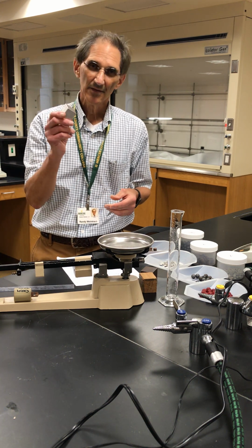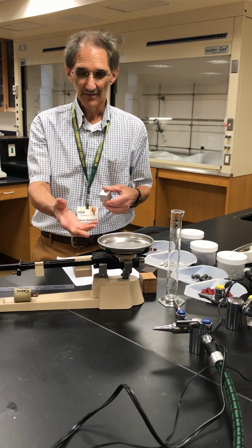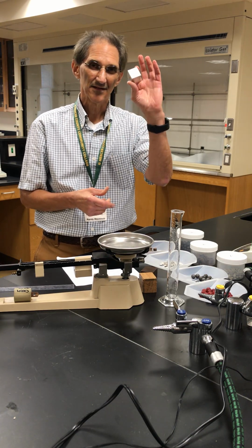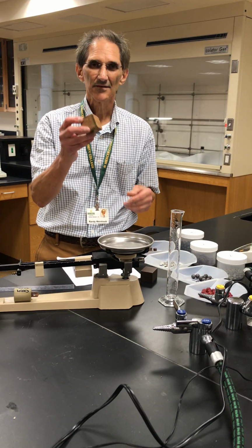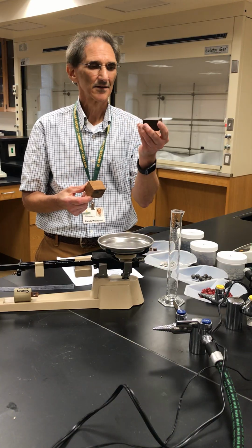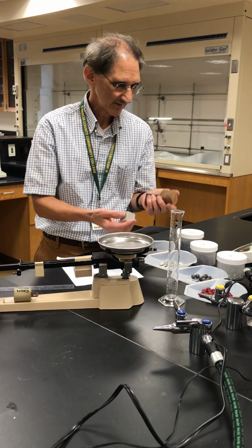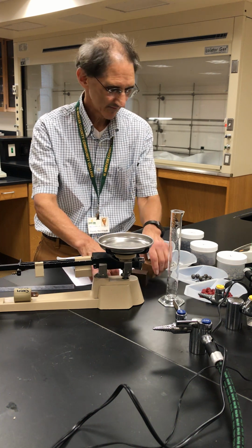So with those measurements we can determine the volume, and we have the mass. We could calculate the density of this. Now I did the same, and you'll get the data for this wood block and for this iron block. And very much different in weights than these three. So you'll calculate the density of those with the data.